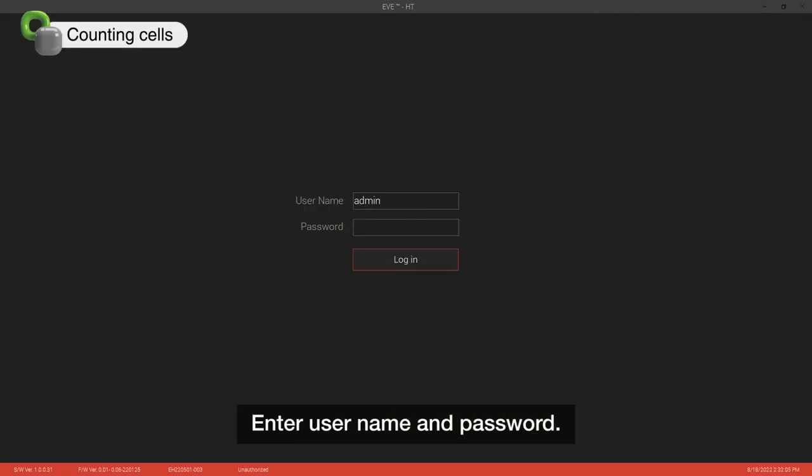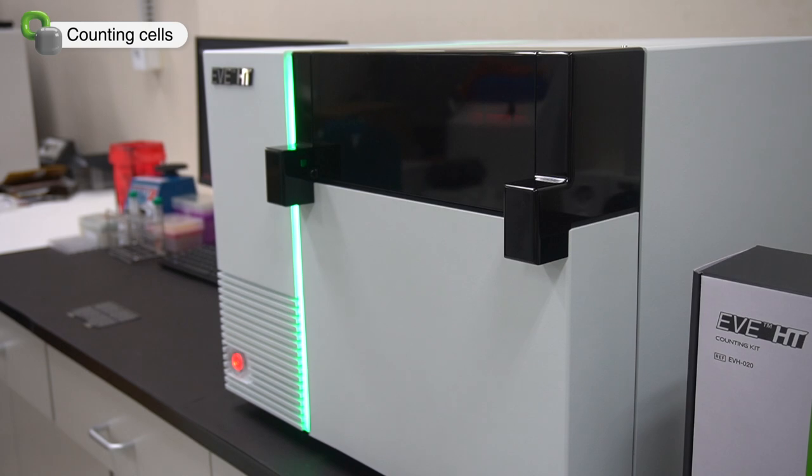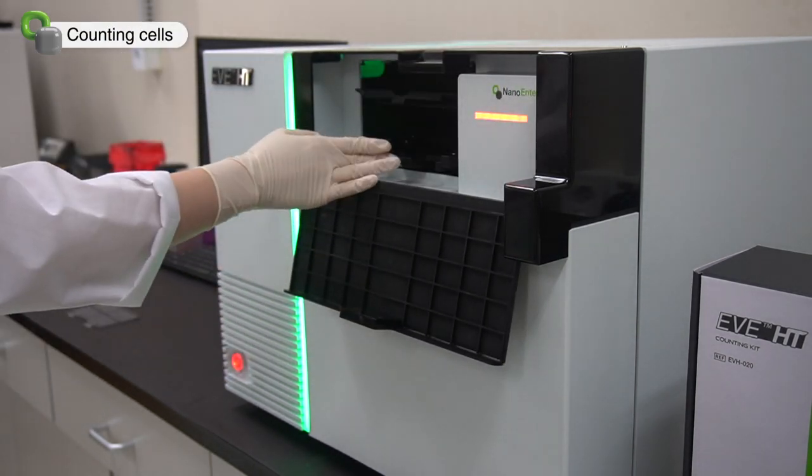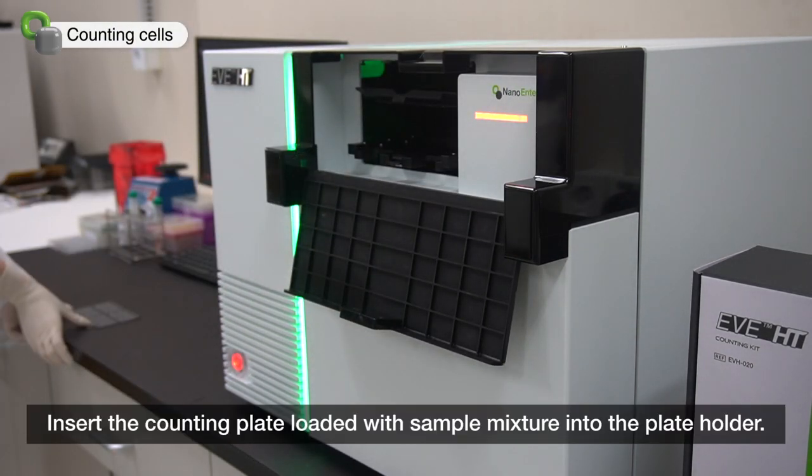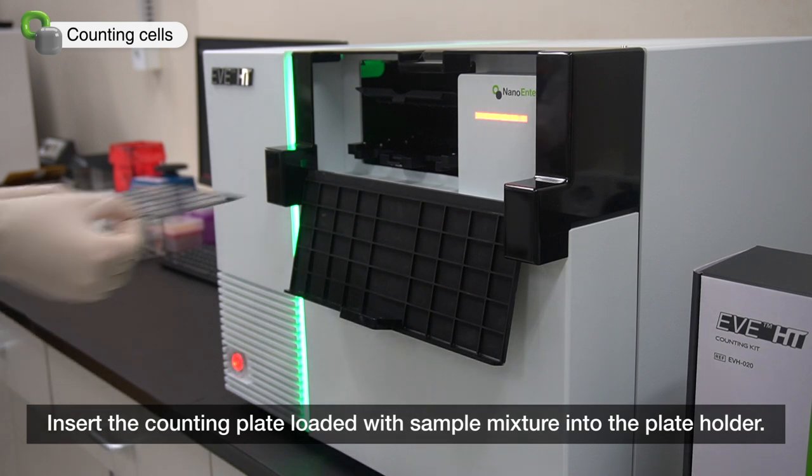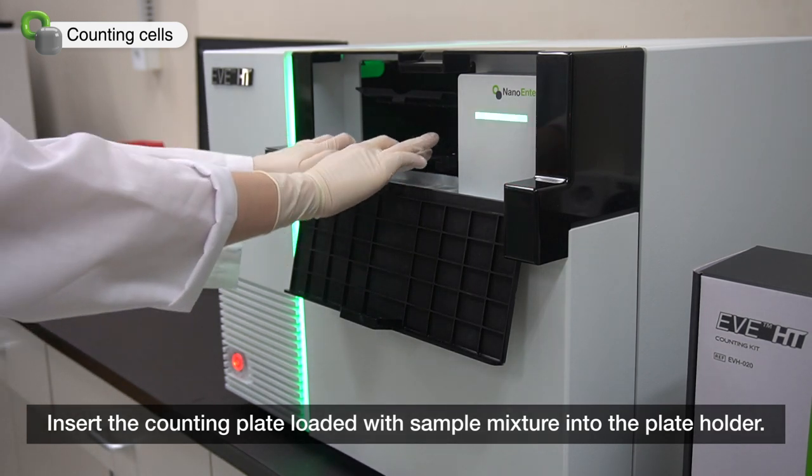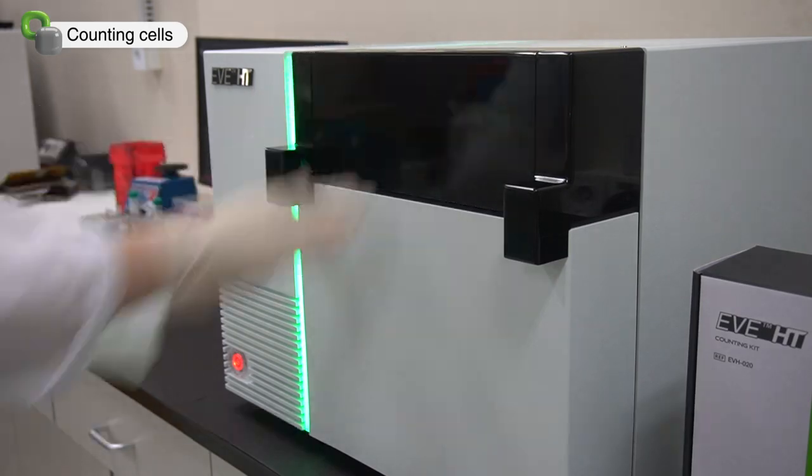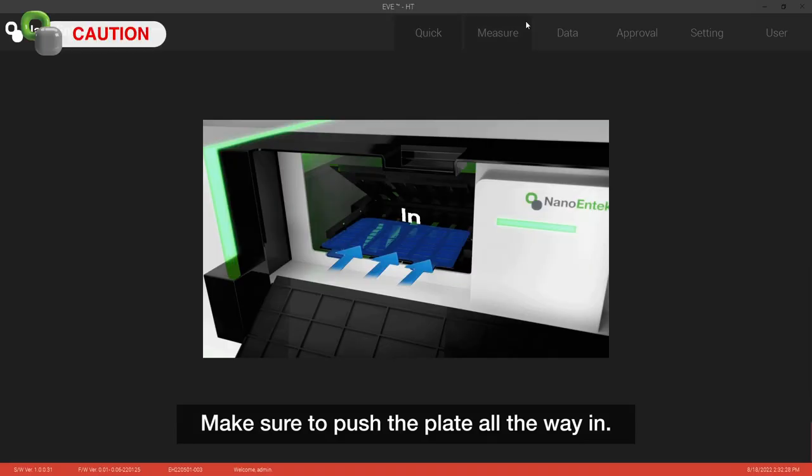Enter username and password. Then open the door and insert the counting plate into the plate holder. Make sure to push the plate all the way in.